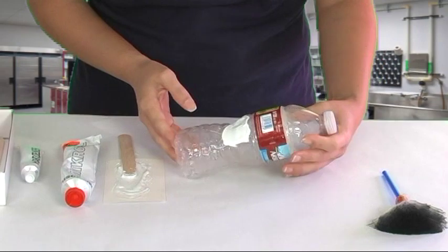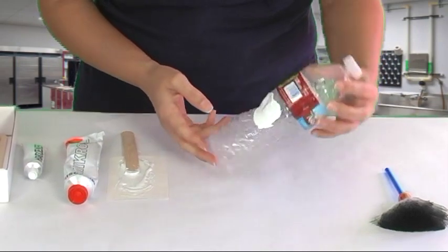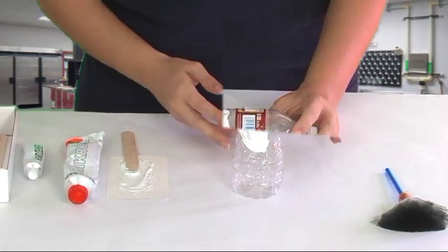And this is going to take about ten to fifteen minutes to completely harden. So you just leave it alone and we'll show you how to lift it.